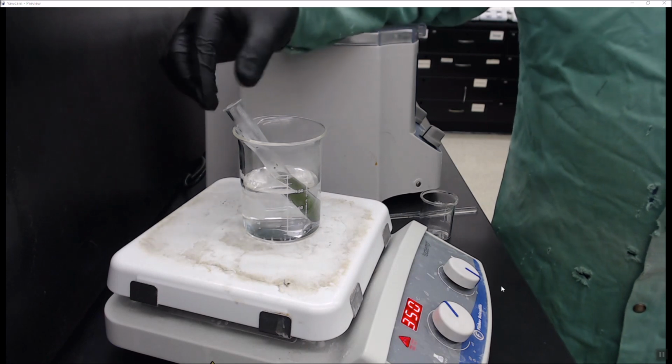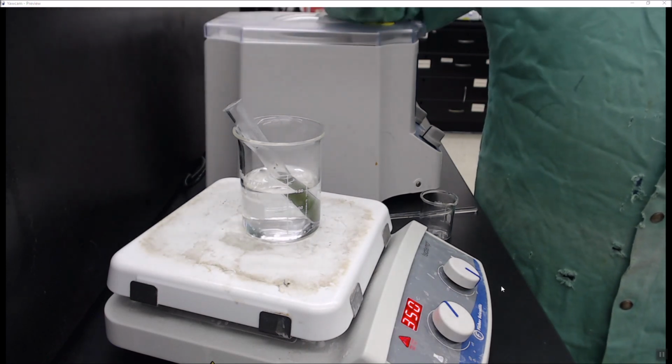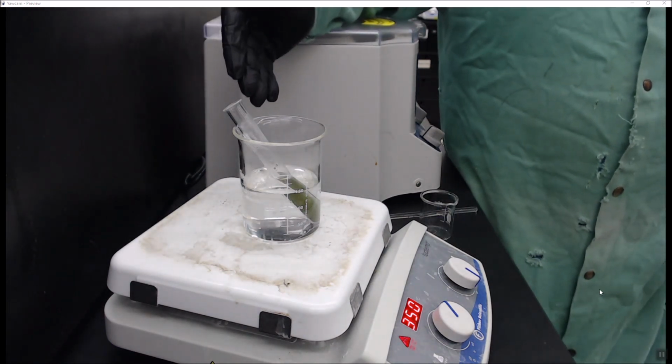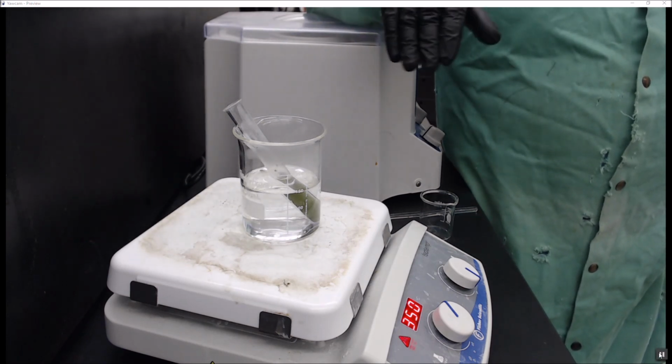And I have one test tube here. You are going to be doing this, obviously, 3 times. You did take the time to flame the 3 test tubes. So we're going to pause the video here. You want to let this cook for about 6 to 8 minutes. And when it's done, we'll come back and you'll see a completely different solution.